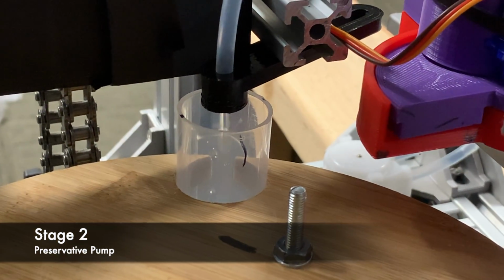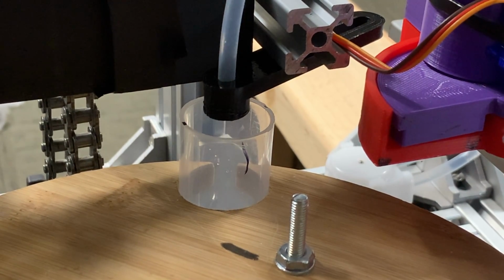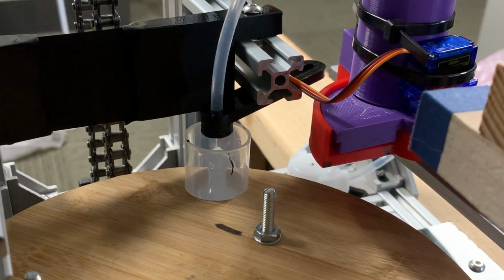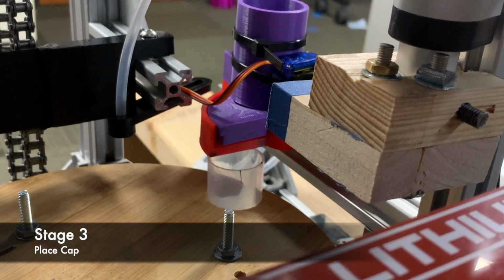The second stage is the preservative pump. After the sample is collected, a preservative is added to the tube with a 12-volt DC peristaltic liquid pump. From there, the sample tube moves to the place cap stage.